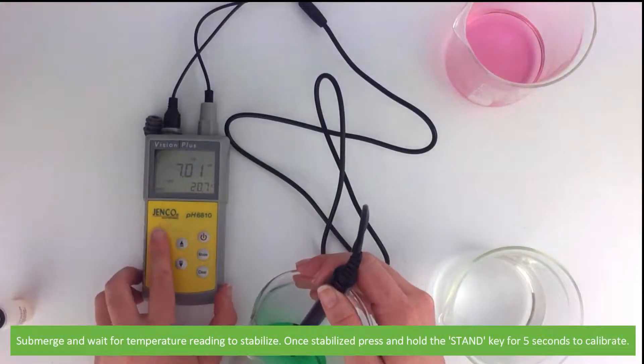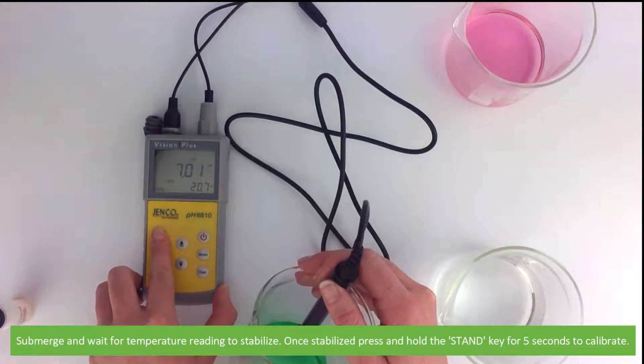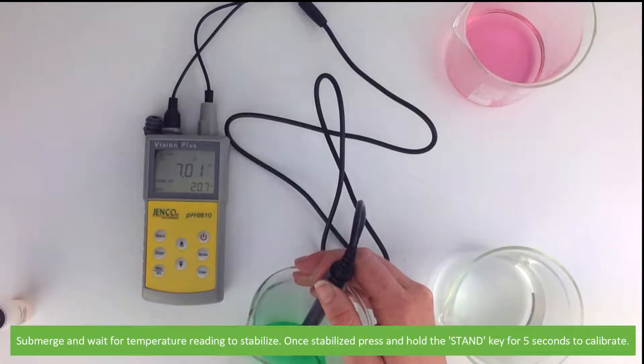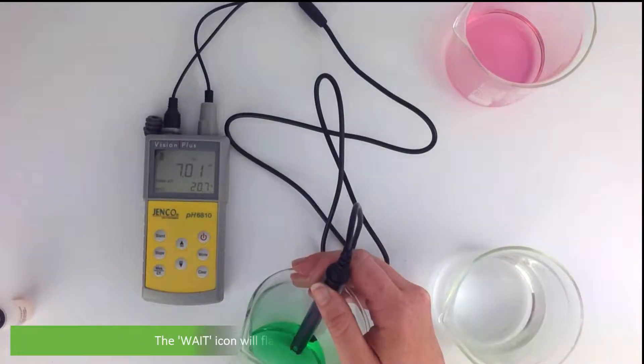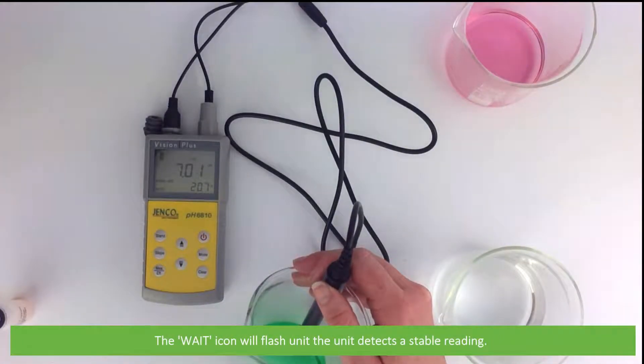Submerge and wait for the temperature reading to stabilize. Once stabilized, press and hold the stand key for five seconds to calibrate. The wait icon will flash until the unit detects a stable reading.